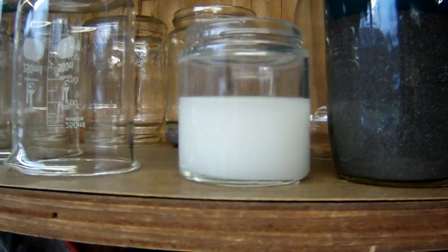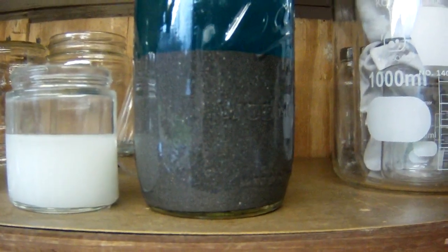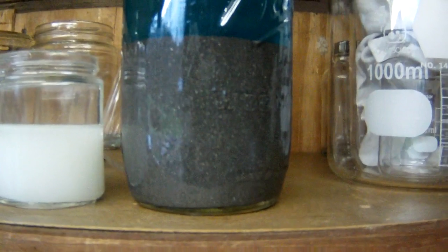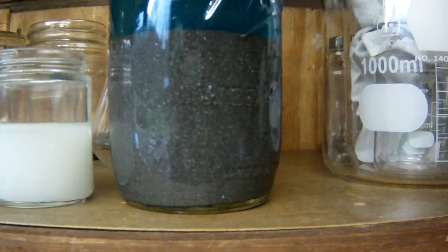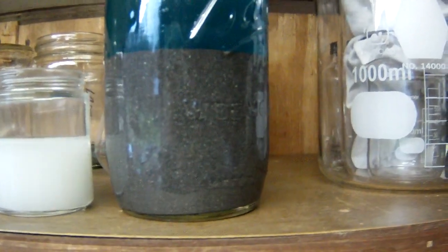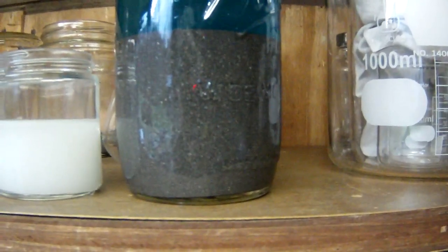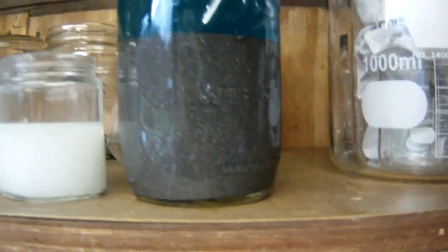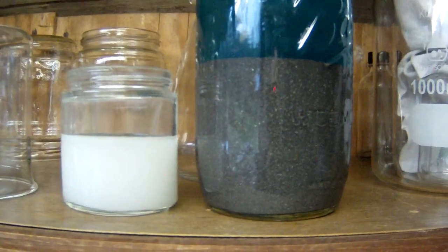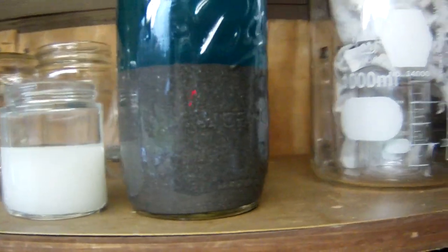You know, I mean, the white is silver chloride, but when we put that copper in there, everything just instantly turned black, and it filled the jar. I mean, it literally filled the jar with that fluffy gray-black precipitant. And I have never seen that before. So I don't know if that is palladium. I don't know if it's something else. I don't know what these contacts came from. But I'm going to let this settle till it completely settles out.